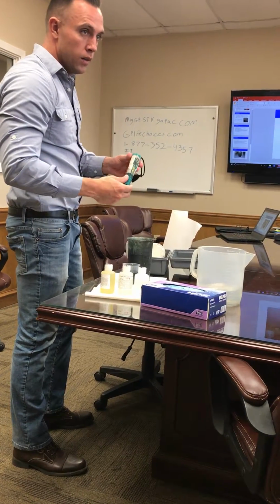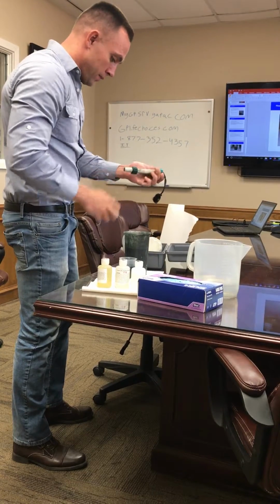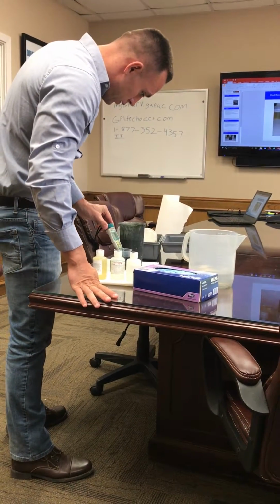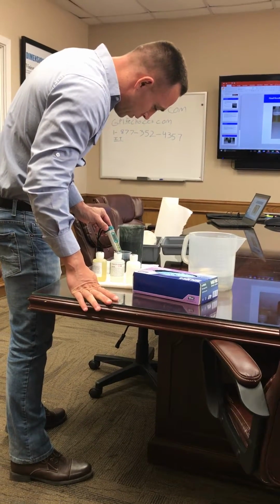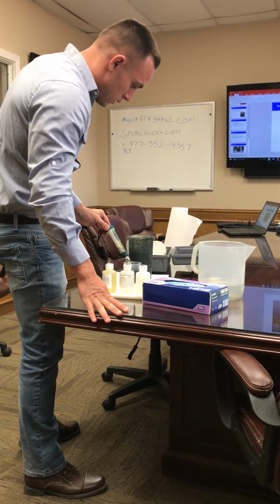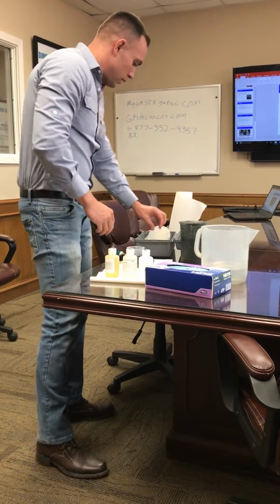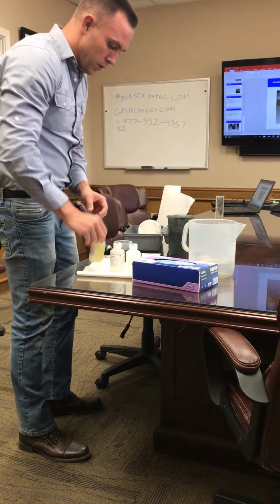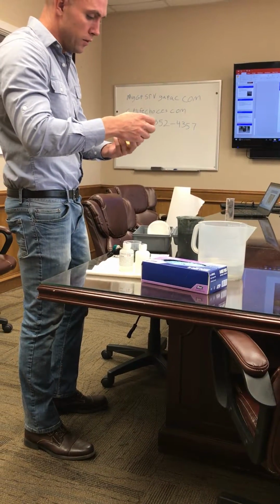This is the pH. Basically, I'll test the pH of my water first. Just right at about 8.55, 8.56. I think at this point we're dropping it down to about 5.5. So 5.7. Yeah, so right around 5.5, 5.7.